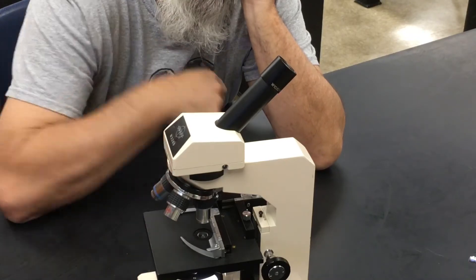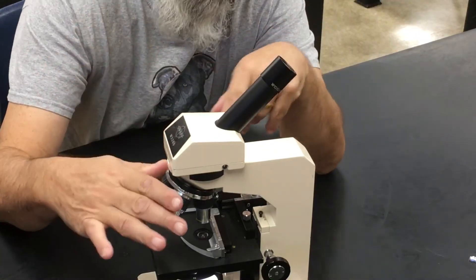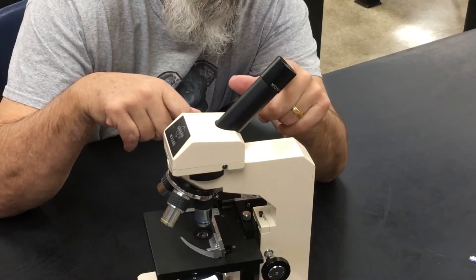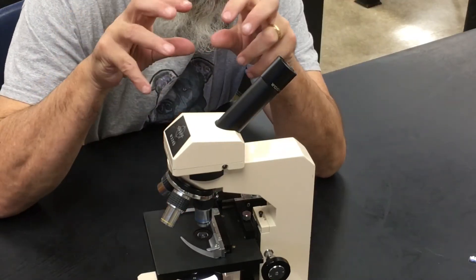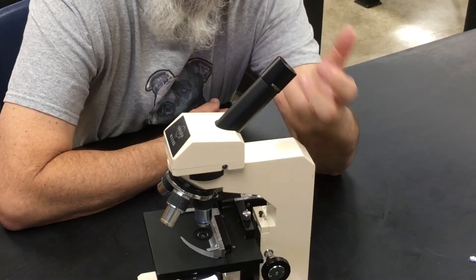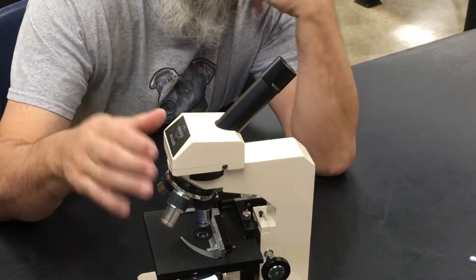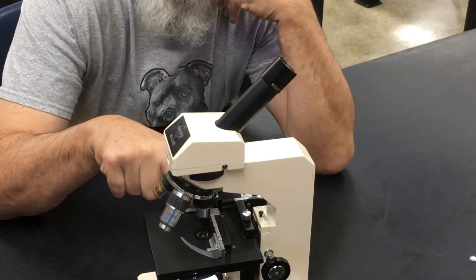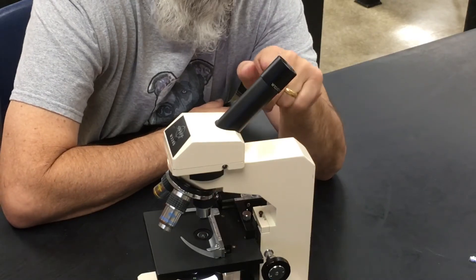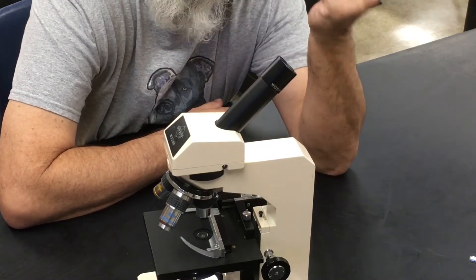Each objective lens has a number on the side that tells its magnification. To find total magnification, you look at the number on the objective lens facing your specimen and multiply it by the ocular lens magnification of 10. The blue lens has a 40 on the side, so 40 times 10 equals 400 total magnification. The low power red lens has a 4, so 4 times 10 is 40 under low power.